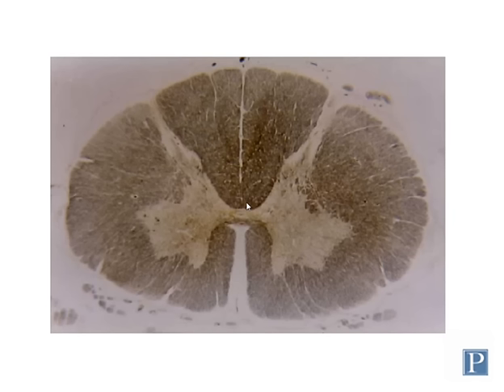Here's a similar section of spinal cord, but that's been prepared with a different type of stain, and somewhat confusingly, one of the common stains for white matter stains it a dark blackish brownish color, leaving the gray matter white. So remember that white matter and gray matter get their names based on how fresh specimens look.